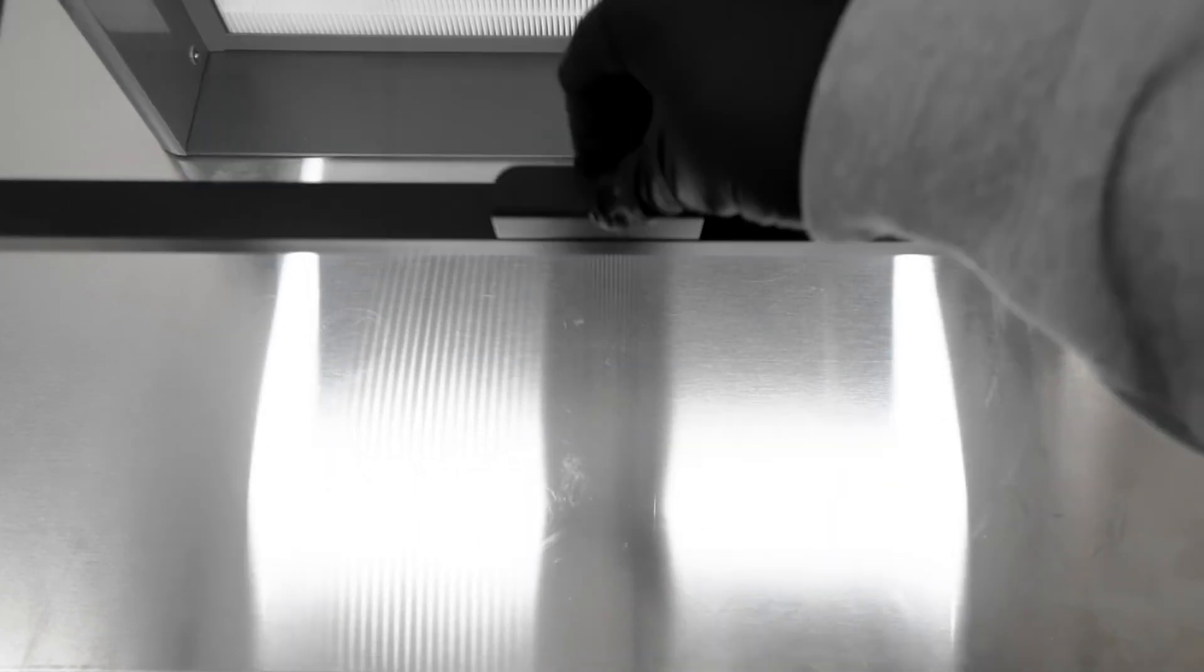Now that the explants have been placed in the proper environment, we wait approximately 60 days for enough growth to propagate. Once there is enough growth, go watch our video on transfer to learn how to further preserve and produce your genetic library.